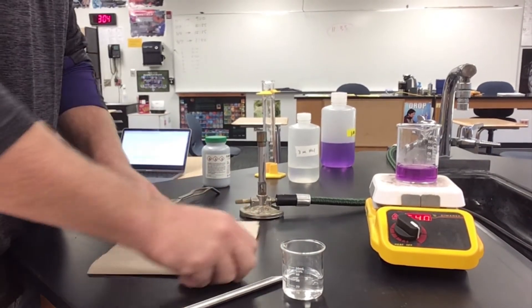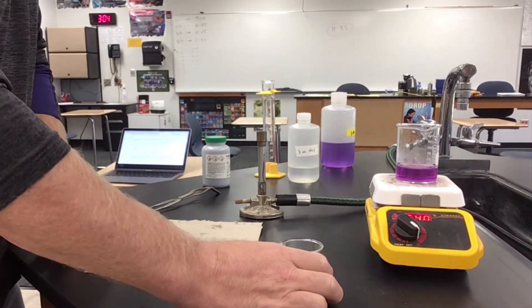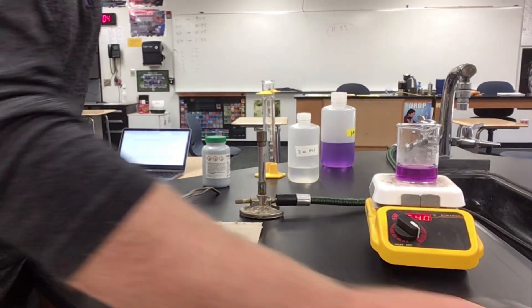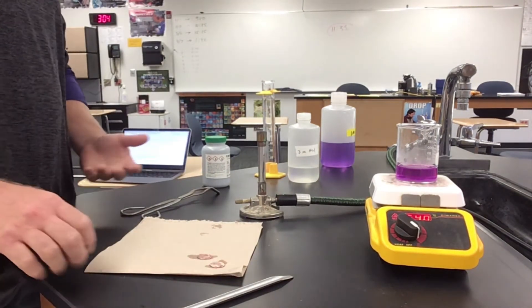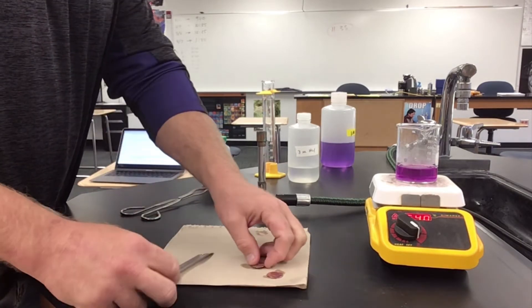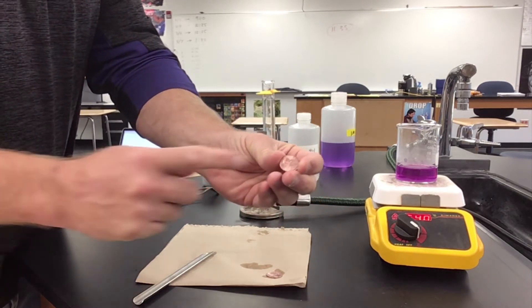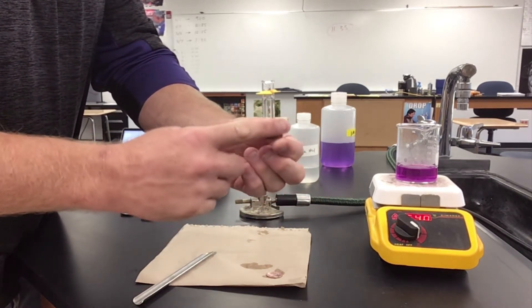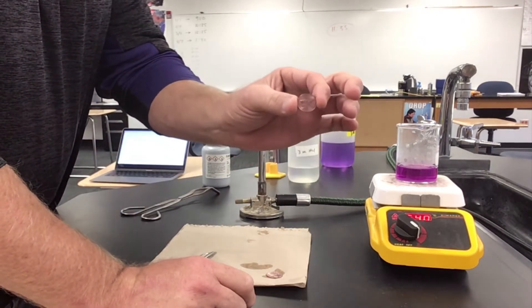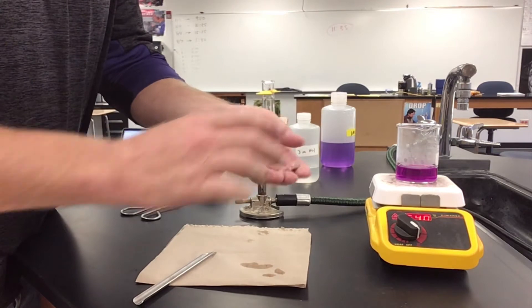I'm waiting for my solution to heat up to a boil. I'm done with my acid bath — I'll leave it here because it can be reused for a future class. Our first step was to put the pennies in the acid bath, and they're now safe to touch again. You'll notice the pennies have a slightly duller look — that's because the acid ate away any material on the surface of the penny and also started to attack the copper a little bit. That's okay because we just need a copper coating.